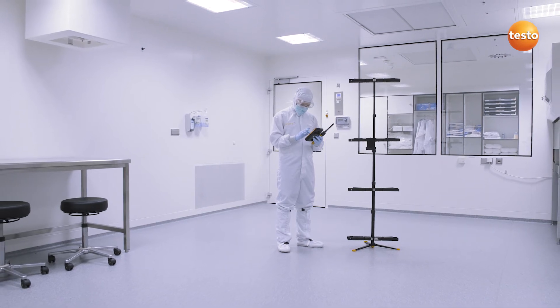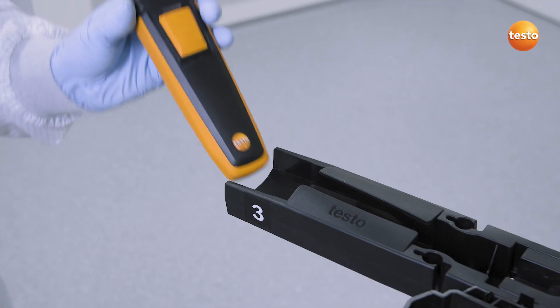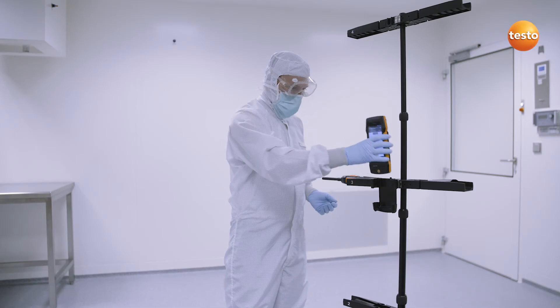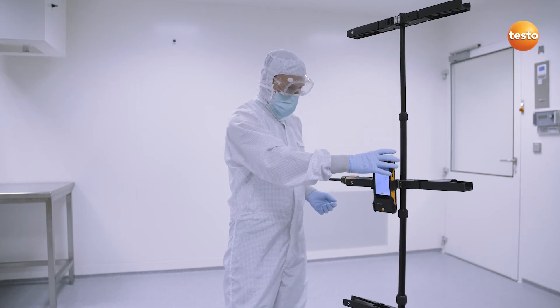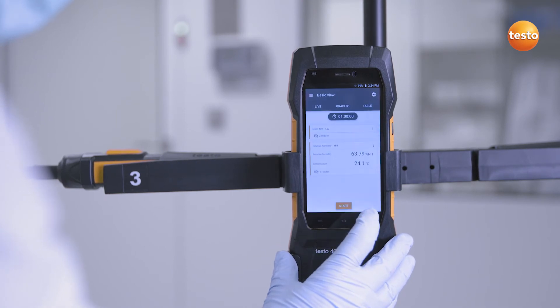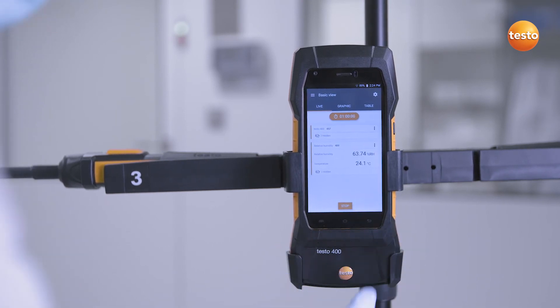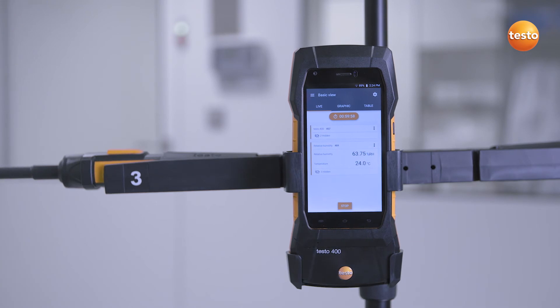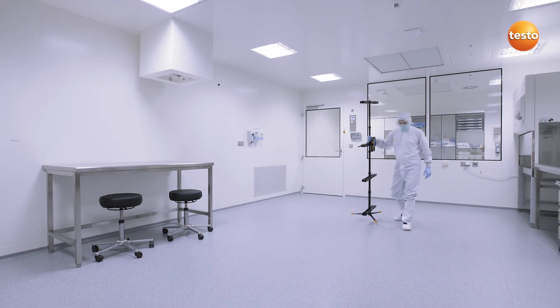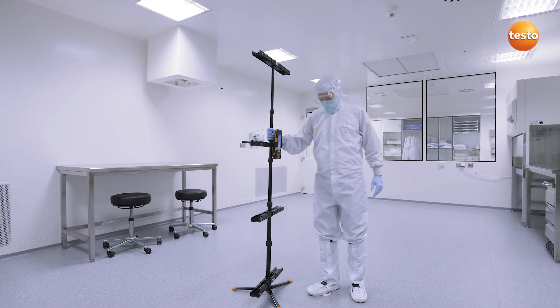After this, we measure the temperature and humidity in the clean room. To do this, we use the highly precise humidity probe and a tripod in order to measure at the prescribed height of 1.10 meters according to the norm, over one hour at a measurement interval of one minute. We carry out this measurement at two different points in the clean room in order to identify any irregularities.